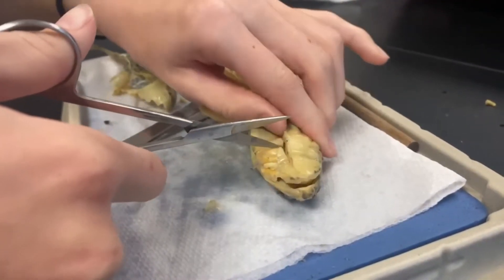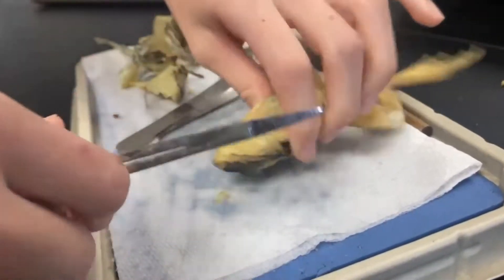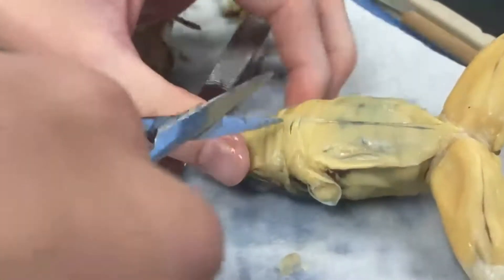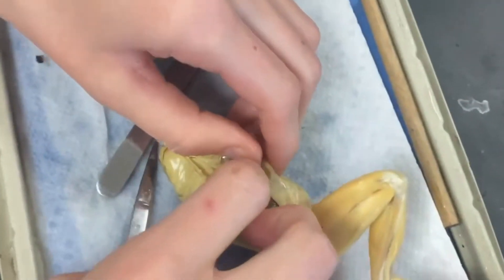Identify each digestive organ on the chart. Use your frog model to help you. Put an X next to the organ once you've observed it. It's kind of thick by the chest. And happy birthday, happy birthday.